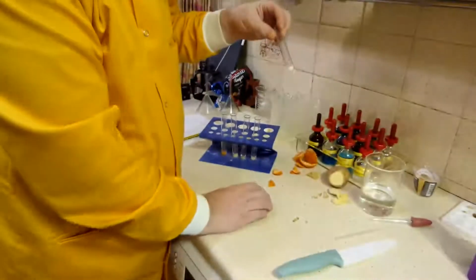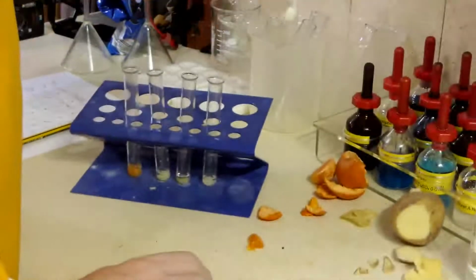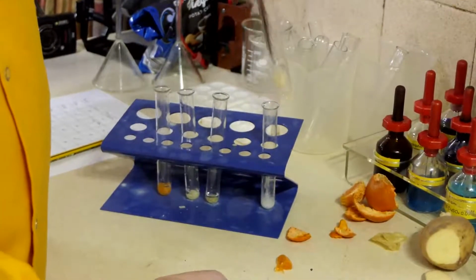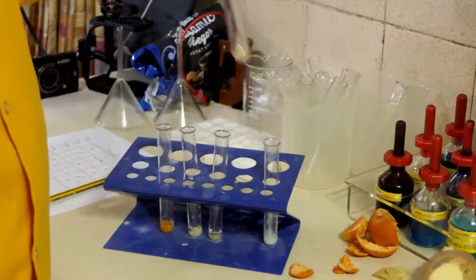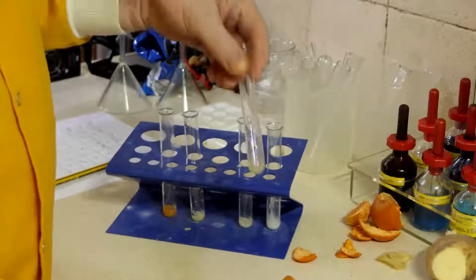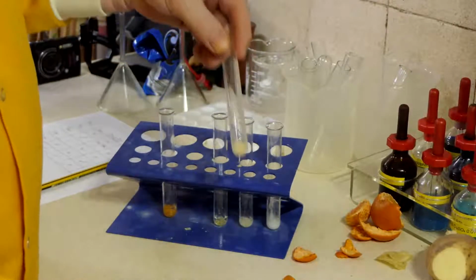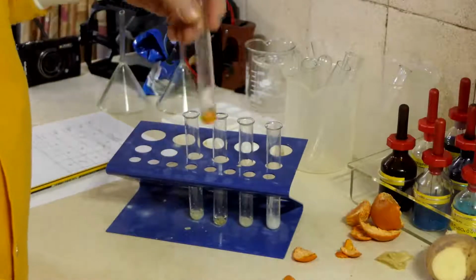Well, that does seem to make the egg go solid, which may not be quite what we want. Give it a good shake with the potato, the crisps, the cheese, and finally the satsuma.